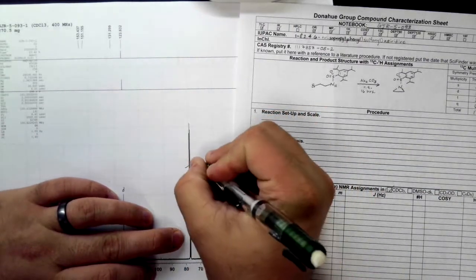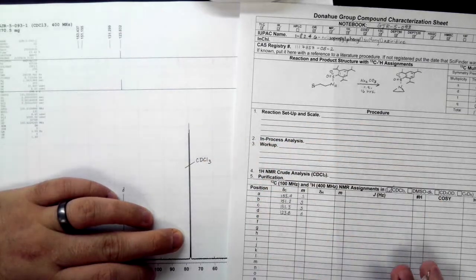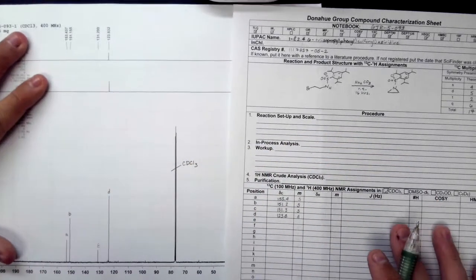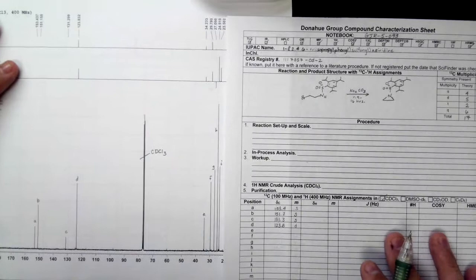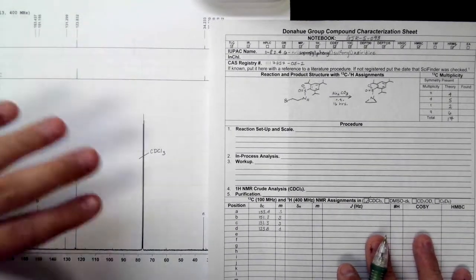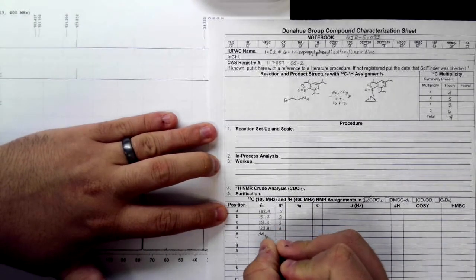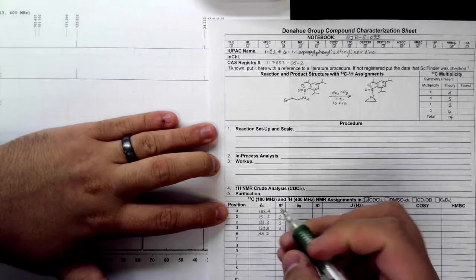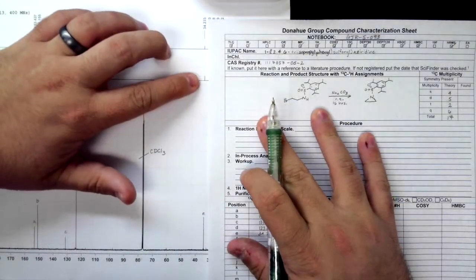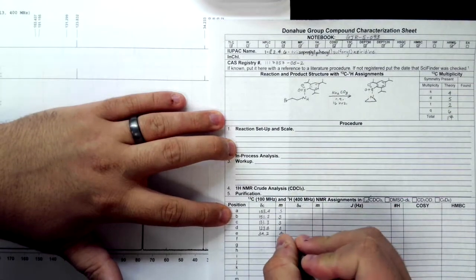Something to mention here is that this is deuterated chloroform, so you do not have to integrate or peak pick that peak. Then when we look at E, E is at 34.2. Same thing, we have a peak up, we have a peak up. This is a doublet.